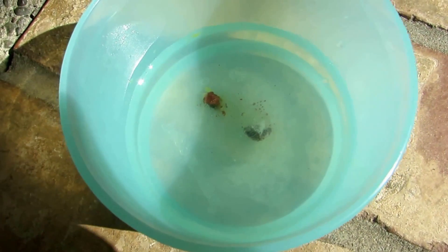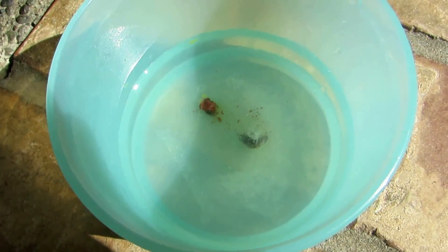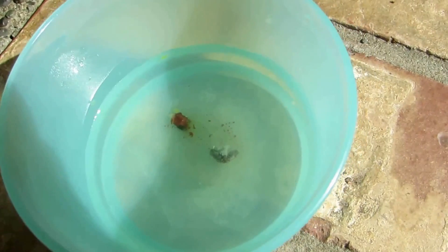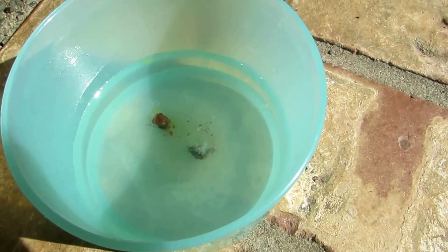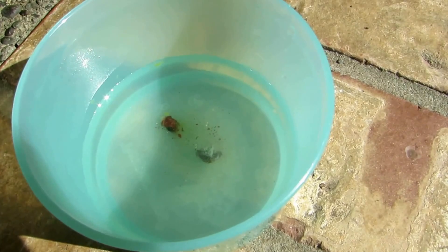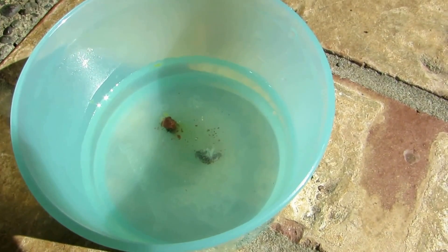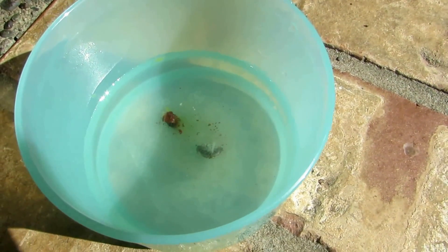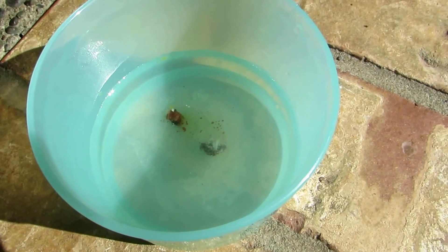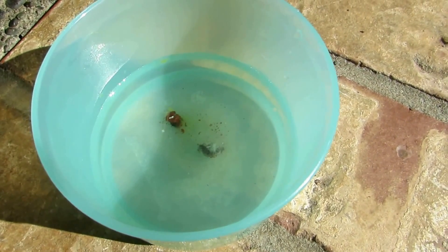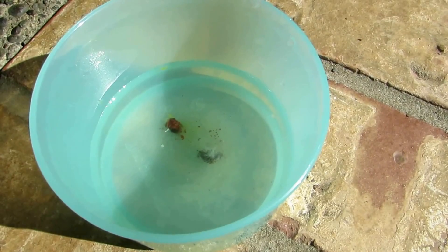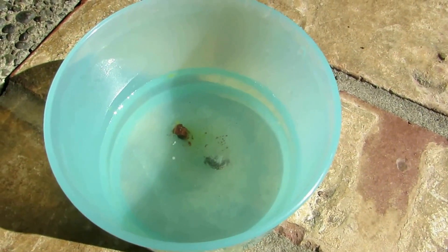So I took the piece of it off the one electrode and it's vigorously bubbling. You can see the steady stream bubbling coming from that one. The other one is not bubbling at all because that was from the other electrode. So we actually did make strontium metal and I'm so excited about that. So I'm going to repeat this a few more times and actually not put it in water the next few times and save some. And we'll actually have some strontium metal. This is amazing. We made some from fireworks.